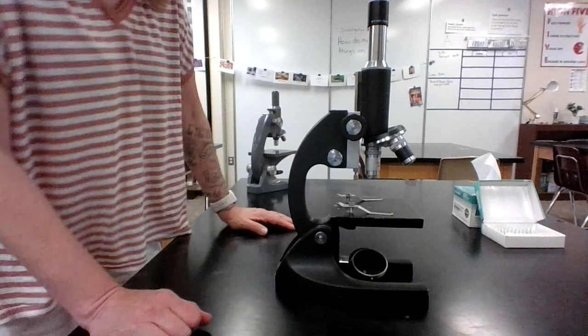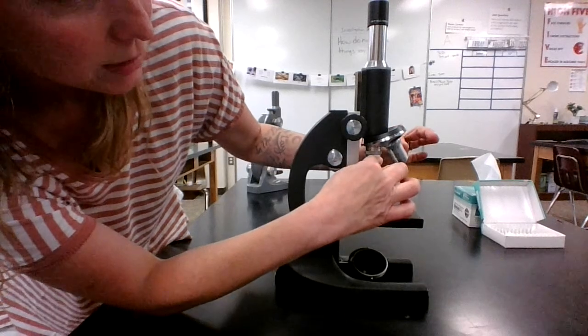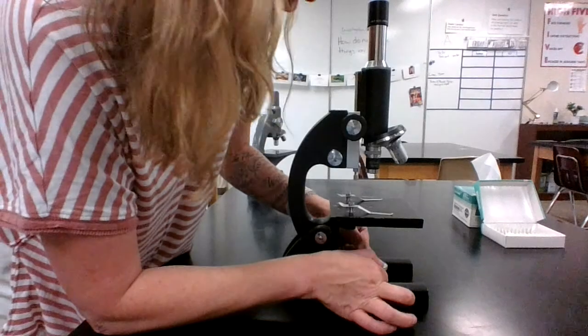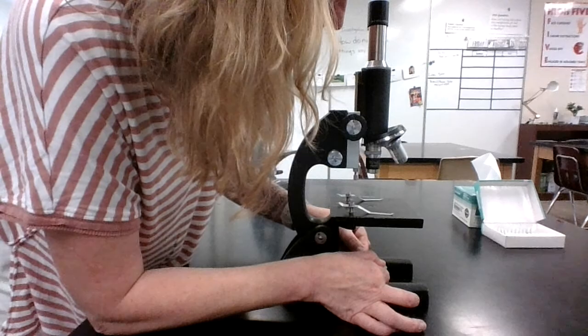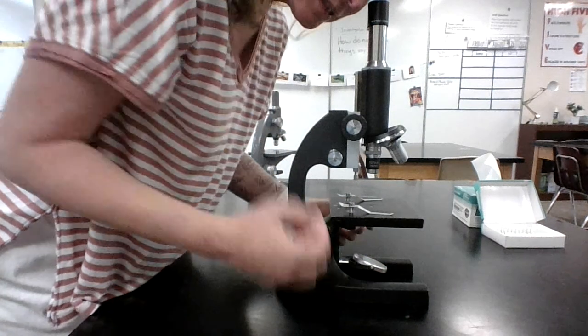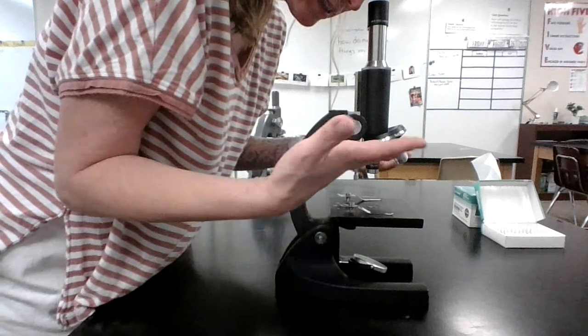All right. First thing I want to do is look from the side and make sure I have the low power lens on. Next, I want to make sure I have light, right? Some of you may be able to move this light or the mirror around and see when the light is shining here. I'm going to be honest, sometimes I have a hard time doing that. For me, the easiest way is to put my eye up near the eyepiece, look in here, and move the mirror until it looks nice and white in there.